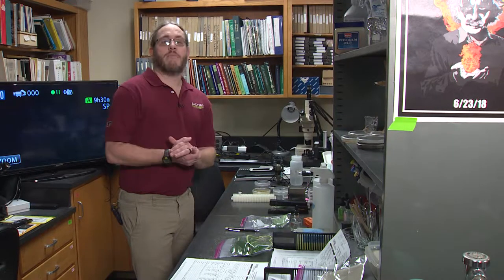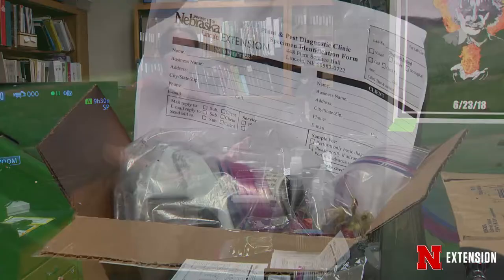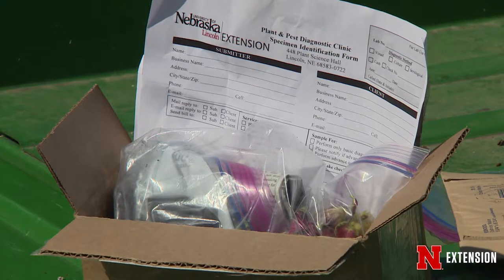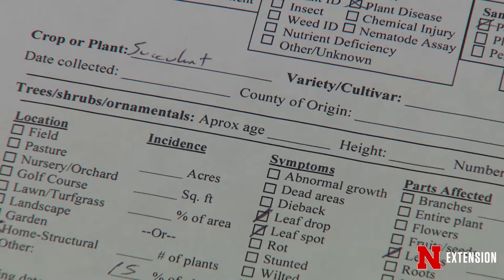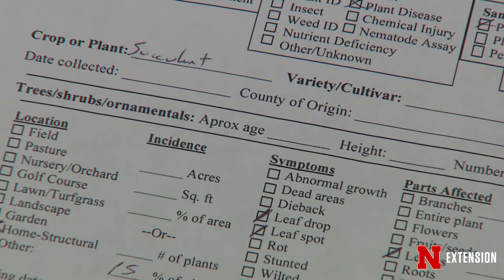When plant samples first come in to the University of Nebraska's Plant and Pest Diagnostic Clinic, there are a variety of tests that we will do in order to figure out what exactly is going wrong with them. We always ask that people submit a sample identification form along with their plant sample, which provides us with most of the information needed to successfully diagnose the sample.